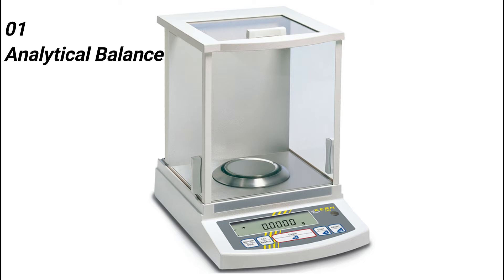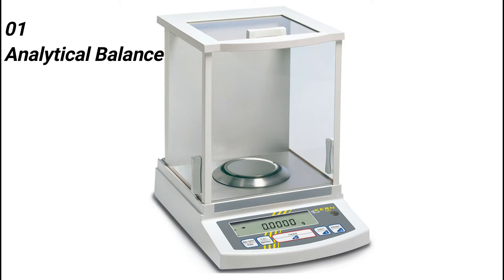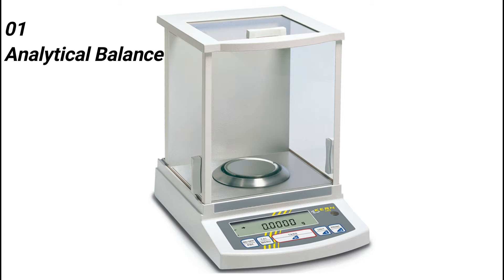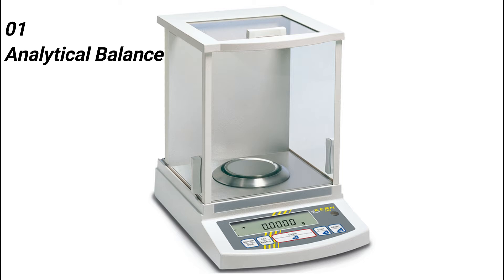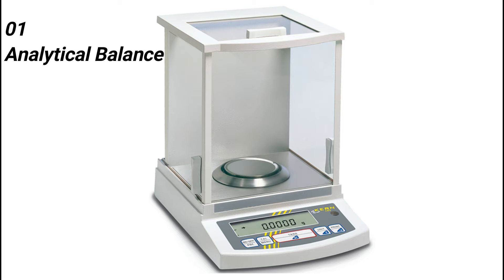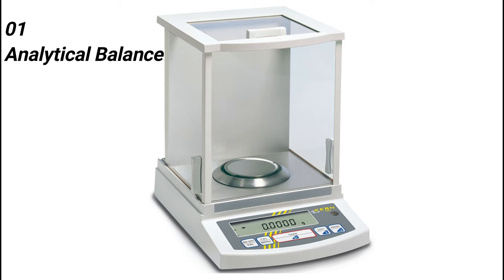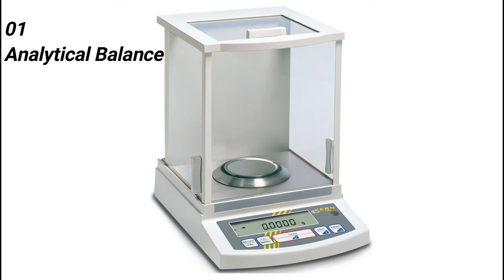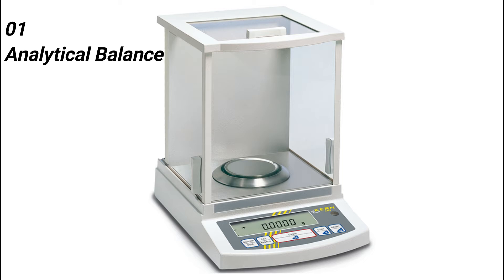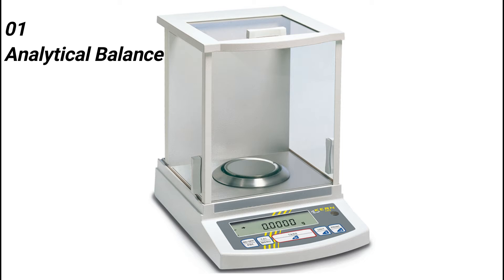Uses: As they are highly precise and based on advanced technology, analytical balances are explicitly used in laboratories for the effective completion of tasks like weighing test materials and sampling amounts, formulation, density determination, purity analysis, quality control testing, and material and conformance testing.